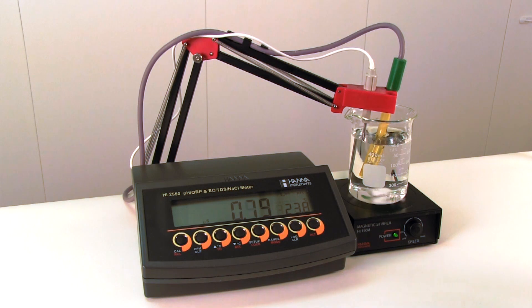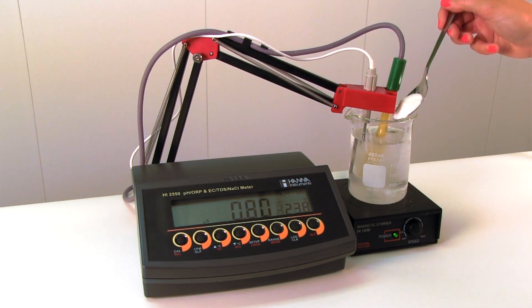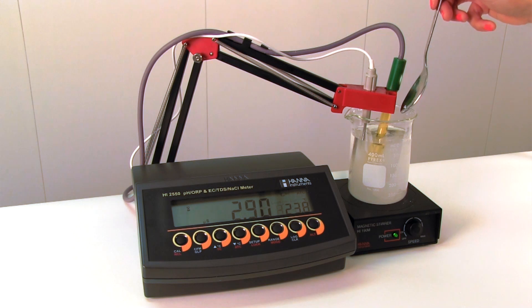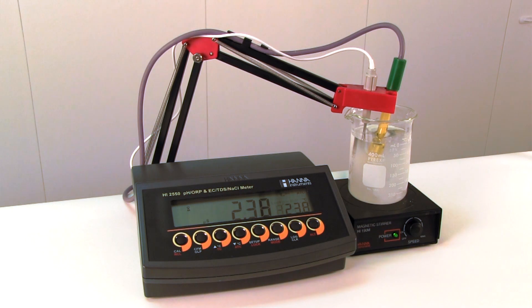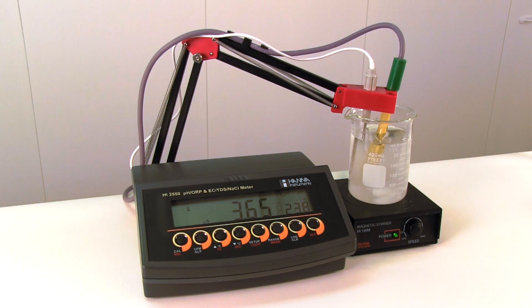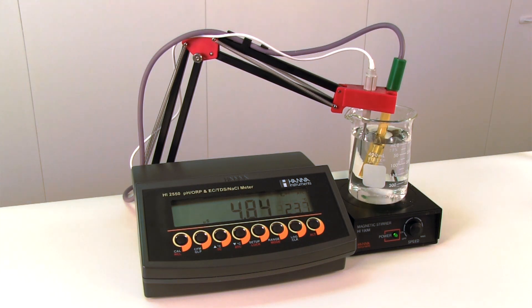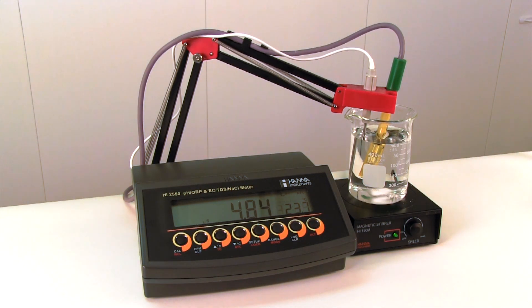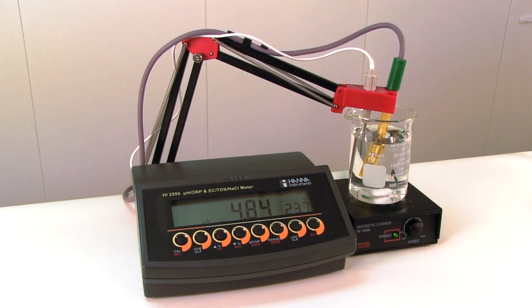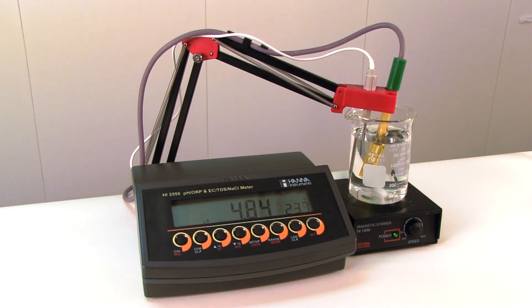Let's move on to see how adding sugar will affect the reading. We will be adding a tablespoon of sugar and stirring until it is dissolved. As you can see, the reading only increased 4.05 microsiemens per centimeter.